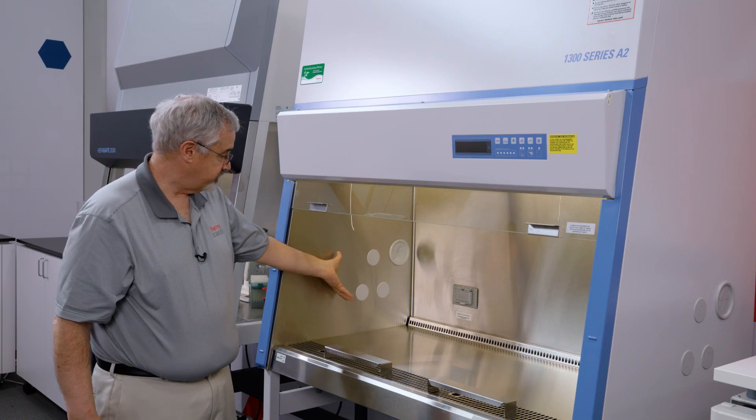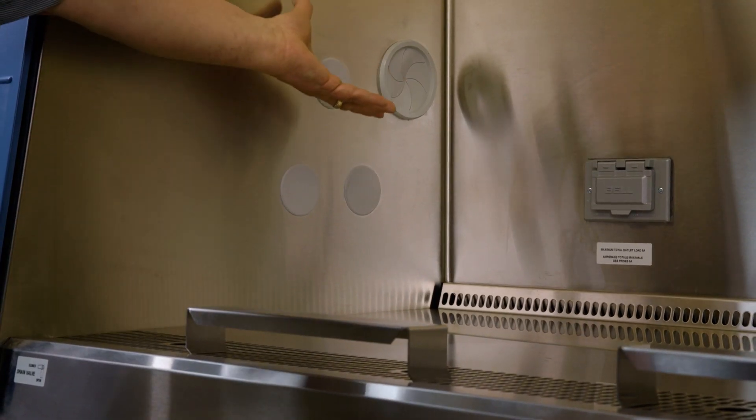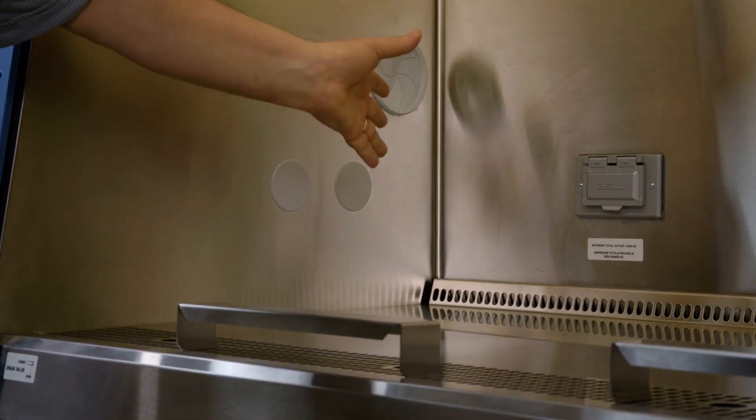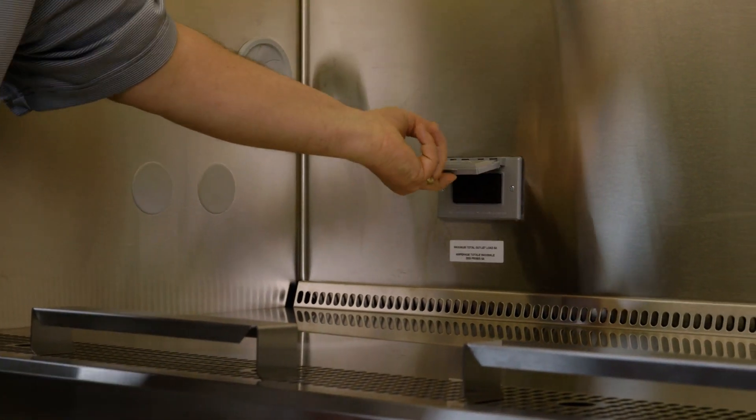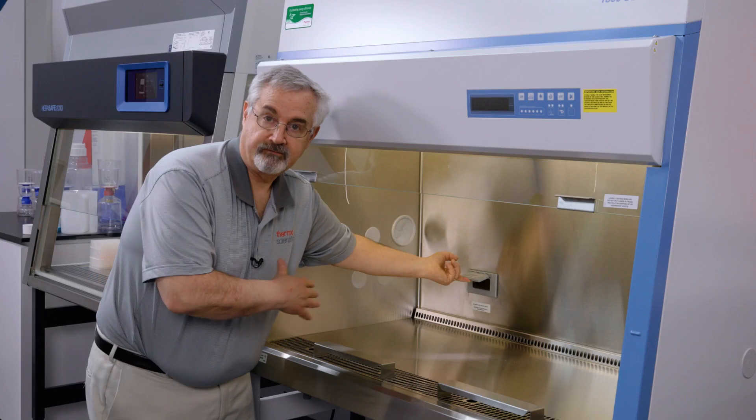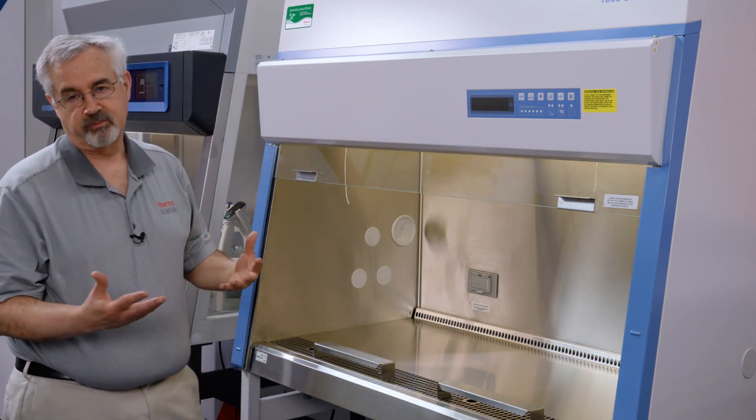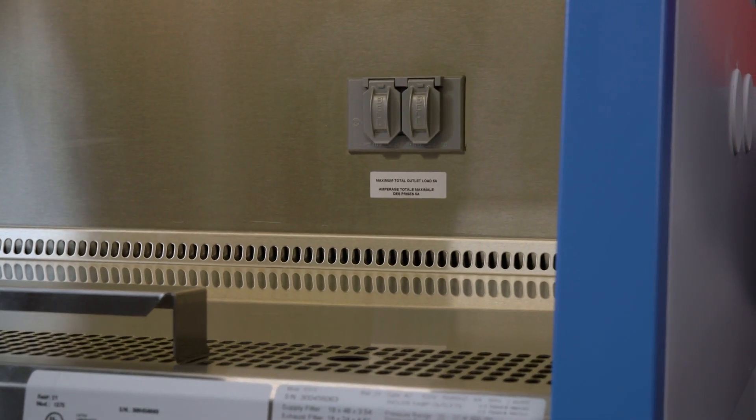We see the three media ports on the left. We see the smart port. We see the two electrical outlets in the back. The one on the left has a ground fault interrupter that protects the circuit for both units and on the right is another smart port and three more media ports.